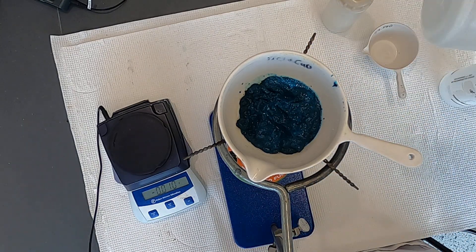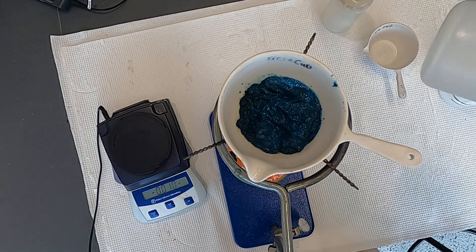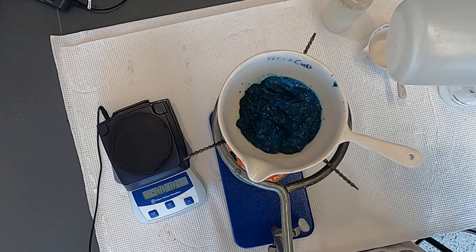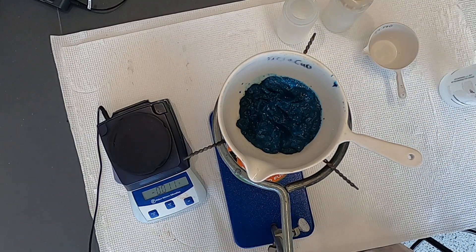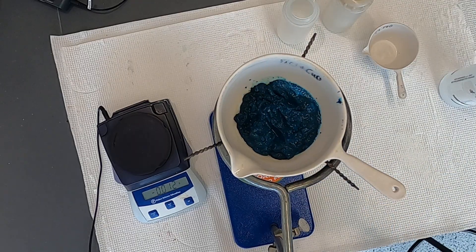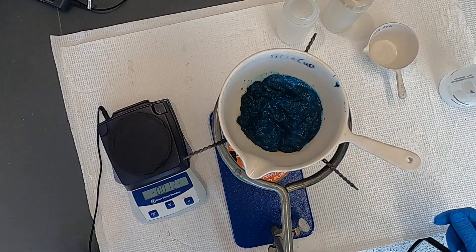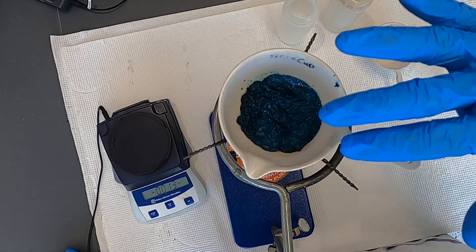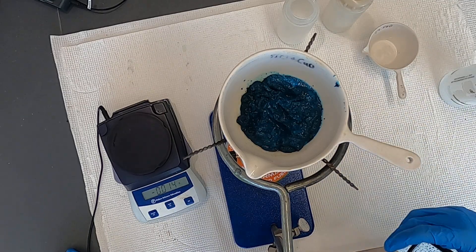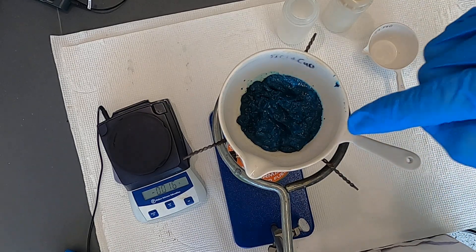One good question is: if I did not do that, would the numbers work out all right? In other words, something else existed in that aqueous layer before, and so that's something to think about as a source of error. However, I rinsed it thoroughly and removed as much of the liquid as I could, so primarily what I have here is copper hydroxide. It's a little wet, but most of the aqueous portion is gone, so any salts that were in the solution that I decanted away should not be present in this.